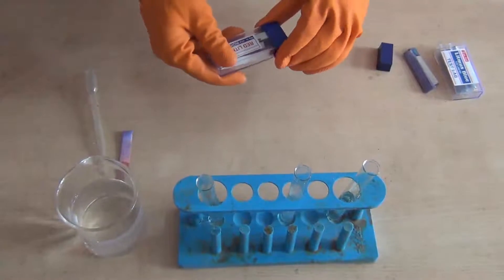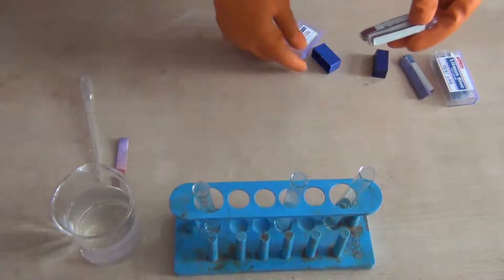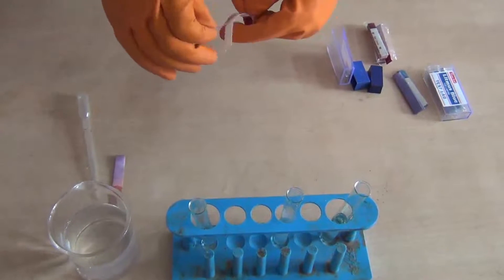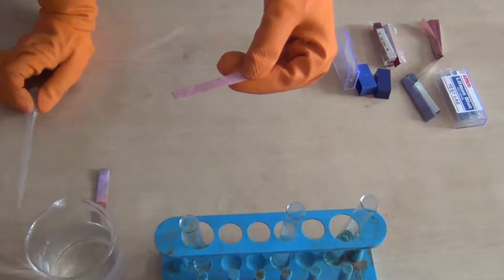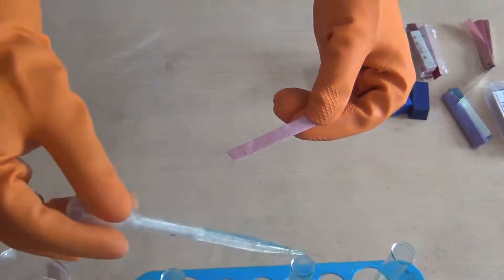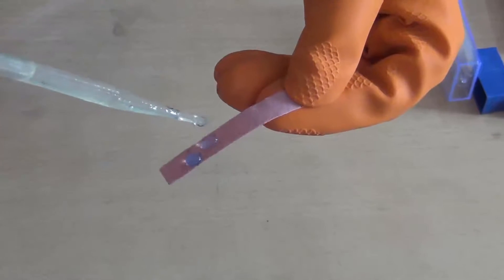And now, let us take the red litmus paper. Take one leaf from the red litmus paper — you can see the color of the litmus paper is red. Now take some amount of solution from test tube B and drop one or two drops over the litmus paper. Observe the change. You can see that the color of the litmus paper has changed from red to blue. So the solution in test tube B is basic in nature.